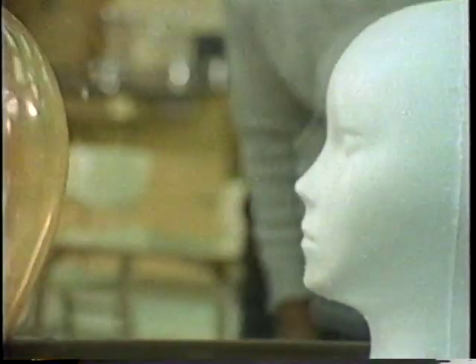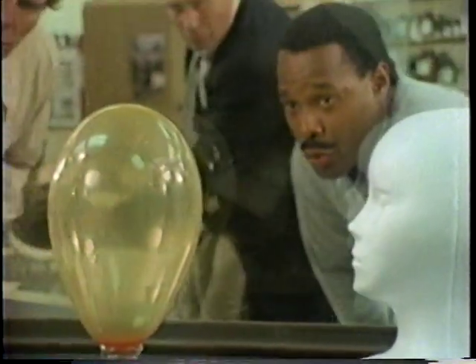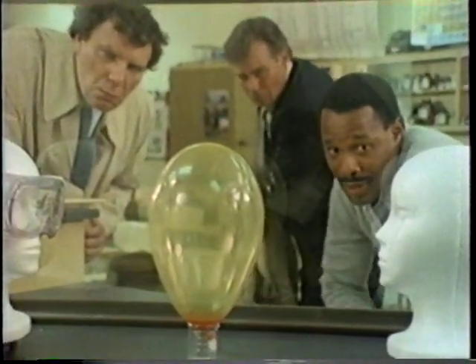Here's a little demonstration I show my students. This balloon contains acetone, red dye, and hydrogen. The heads are styrofoam. One has a pair of safety goggles, the other does not. I'm going to simulate a small explosion, one you might encounter in a lab.